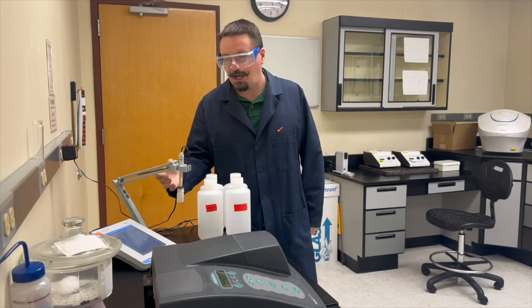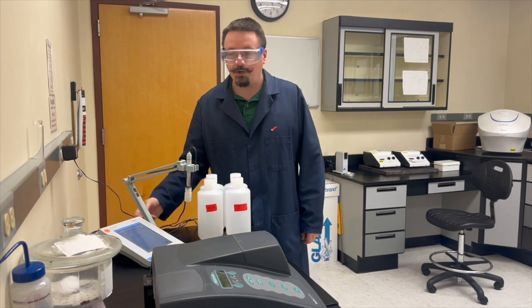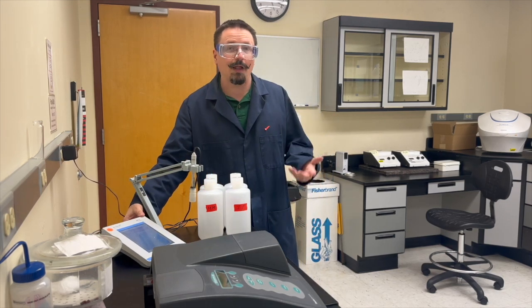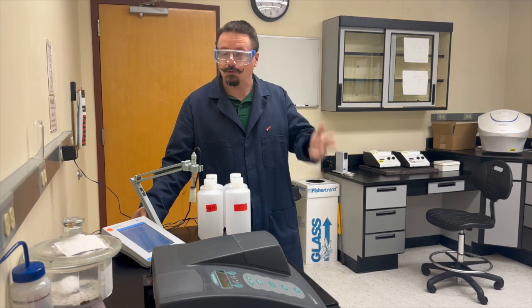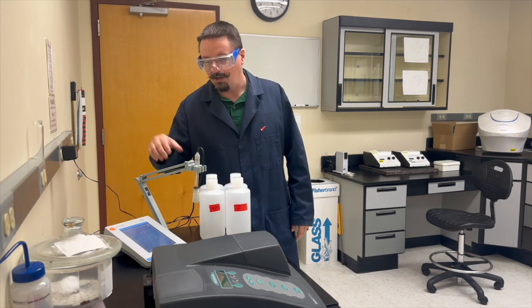The first thing to note: you need to do four different things. The first two will have to be done in that order, but three and four could be switched — you could do four first or three first, it doesn't matter.